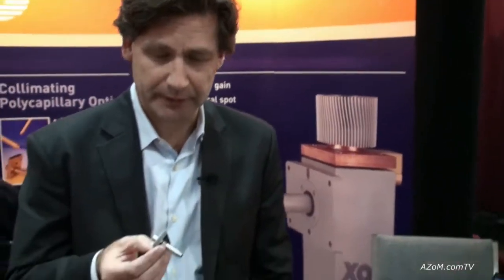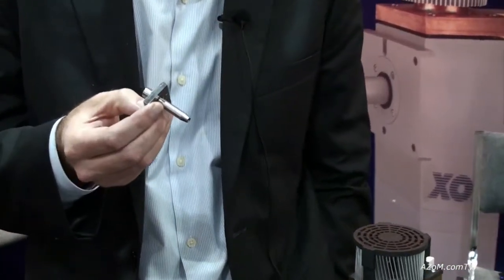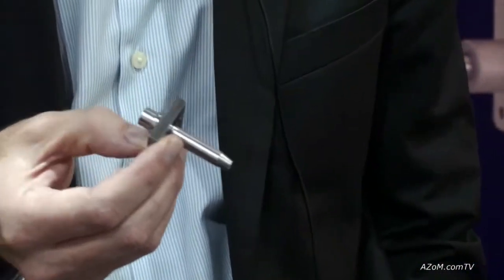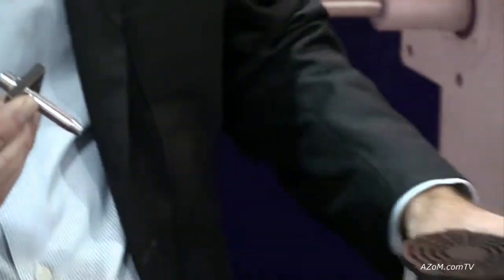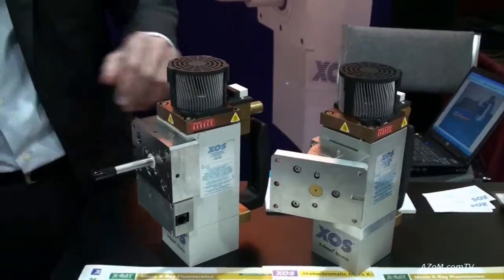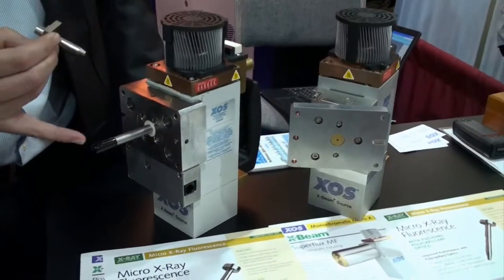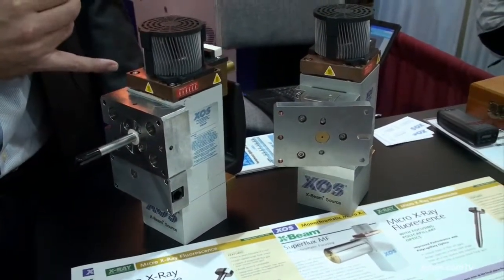These X-Ray optics are used in combination with an X-Ray tube, and at times the customer will provide the tube themselves, or we can integrate the X-Ray tube to the optic for the customer. In that case the product looks something like this — what we refer to as an X-Beam, which has the X-Ray optic right up front and is integrated with an X-Ray tube.